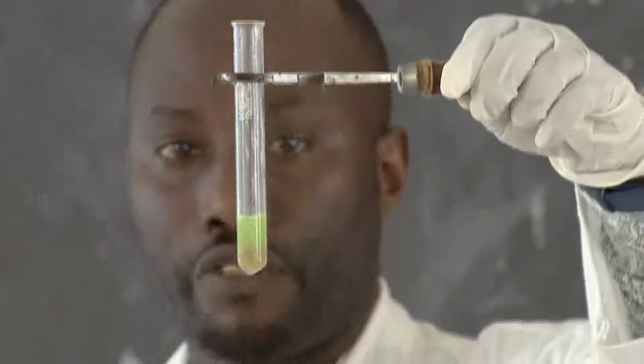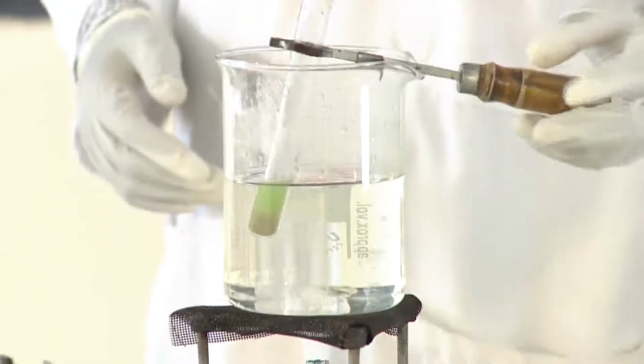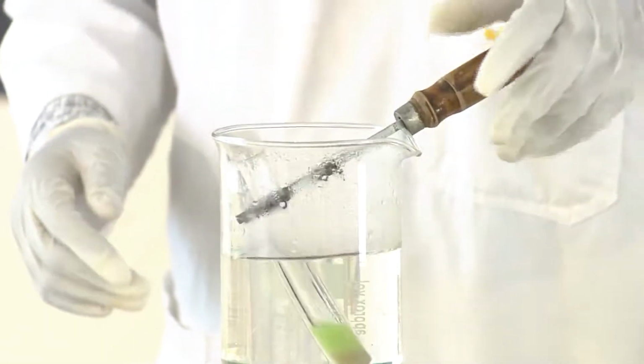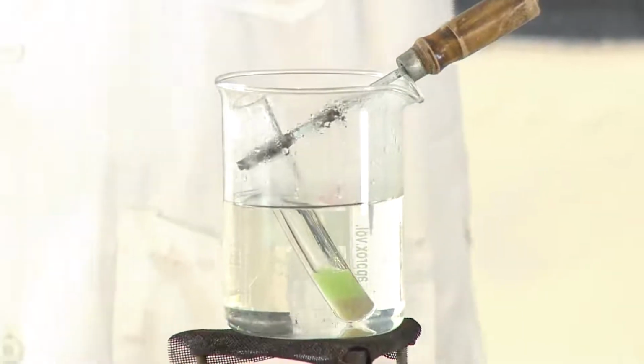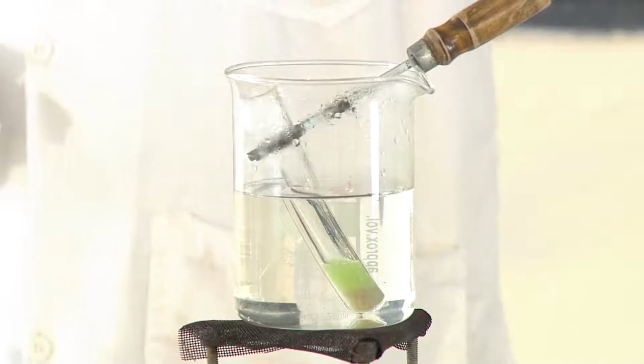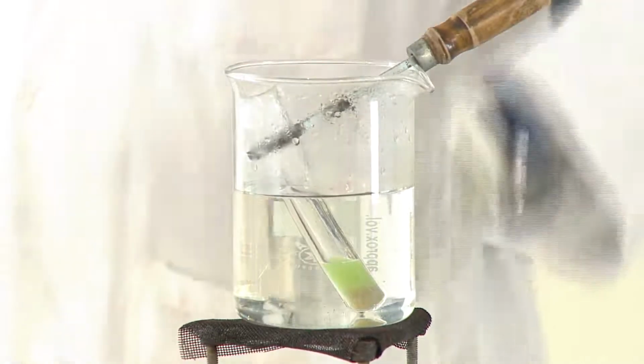We are observing it is changing from blue to green. So let us note something on the chalkboard, and then we write it. Meanwhile, we need to wait and see if it changes from green to yellow and finally to orange, or to moderate orange.